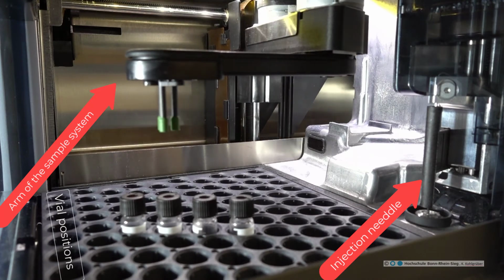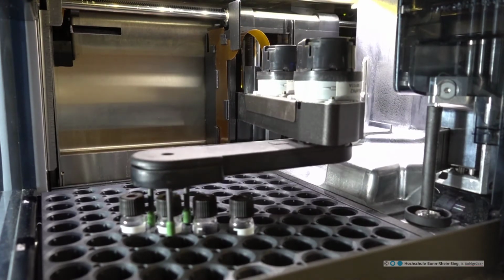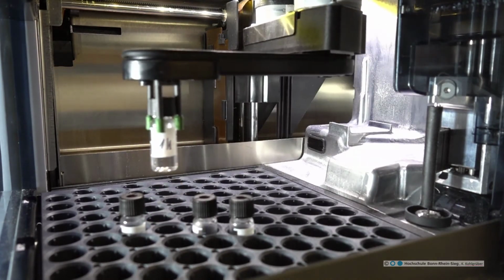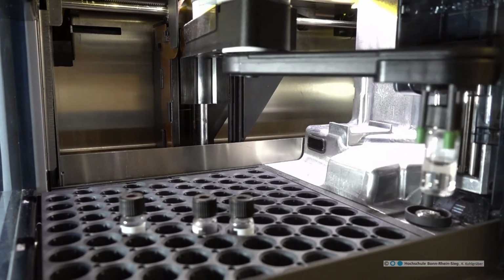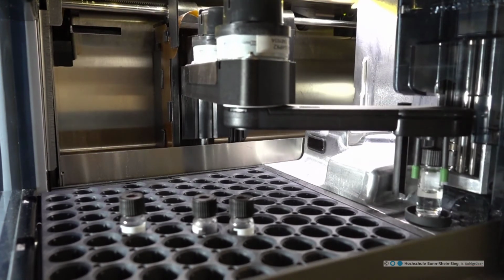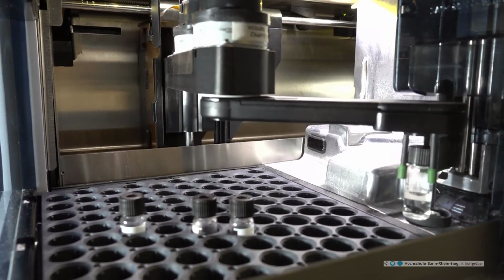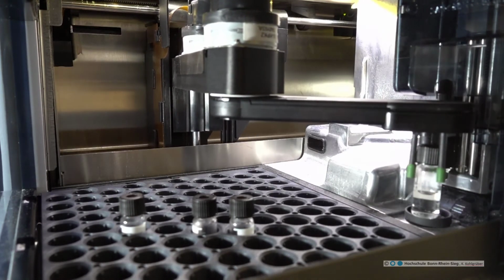The arm of the automatic sample system takes the sample vial from the position which was defined in the software before and brings it to the injection needle. It pierces the septum of the sample vial and takes the injection volume which is defined in the measurement method, here 10 microliter. After injection, the arm brings the vial back to the defined vial position.